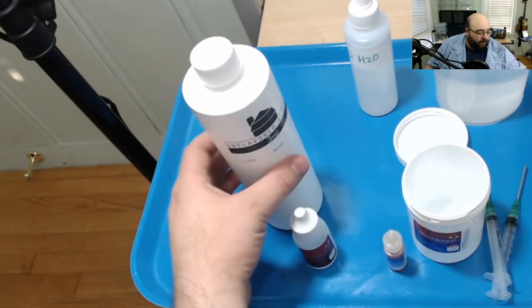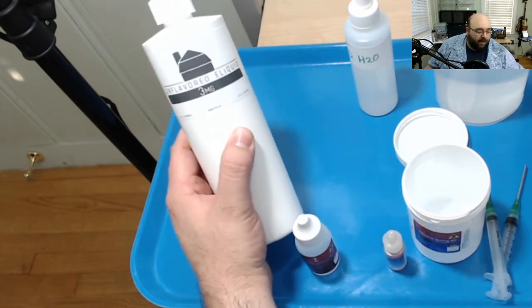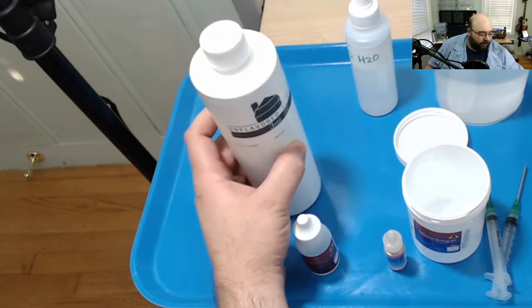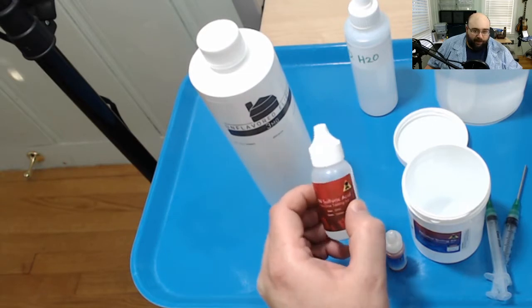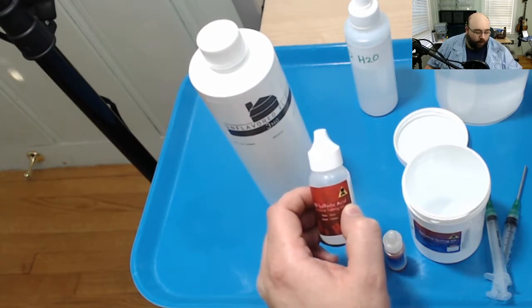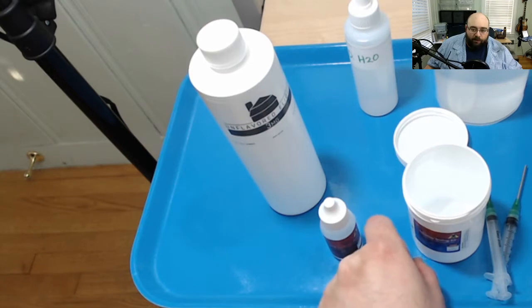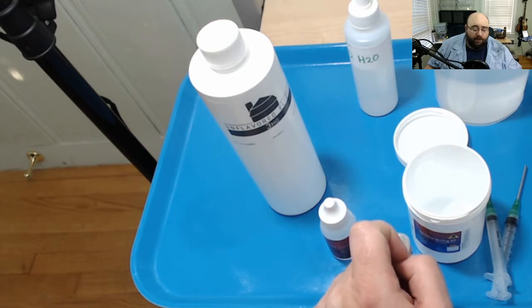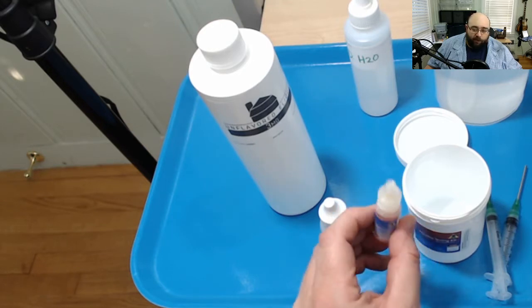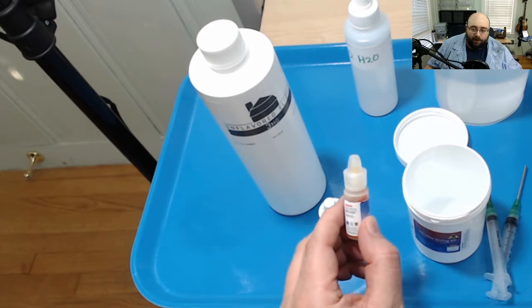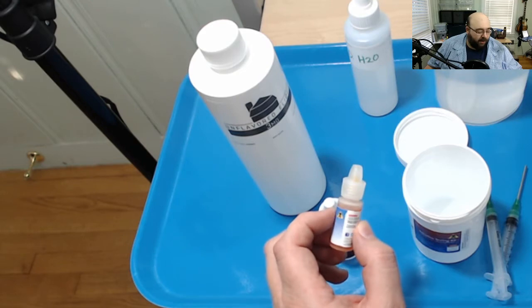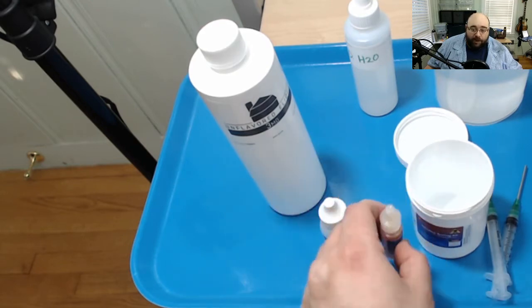So since nicotine is an alkali it's a pH high and acid is an acid it's a pH low. We're going to try to tune this so that we want it with a neutral solution around pH 7. And this is a visual indicator. So when it's alkaline it turns blue and when it's neutral it turns yellow. It's really that simple.